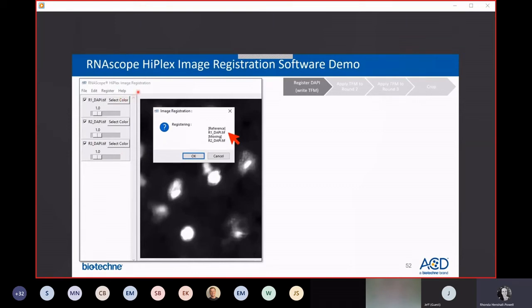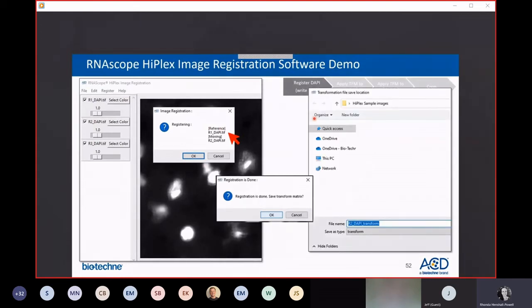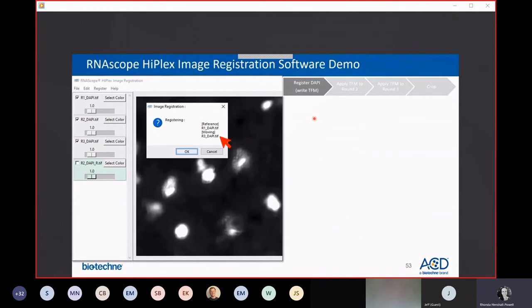So when you select that Register DAPI Images option, you'll see a dialog box pop up, and it will tell you which is your reference image and which image it's moving to align to your reference image. It will ask you to save the transformation matrix that it has just written. The program will suggest a name. Just save it with some name that lets you know which round of staining it came from. And once the registered image is created, you'll see it appear in the dashboard highlighted in green with an underscore R after the name for registered.